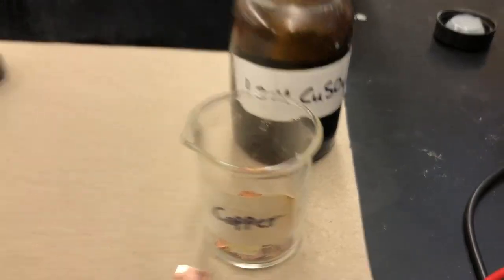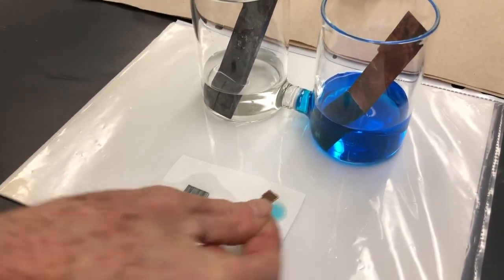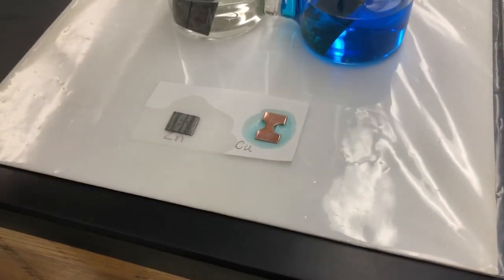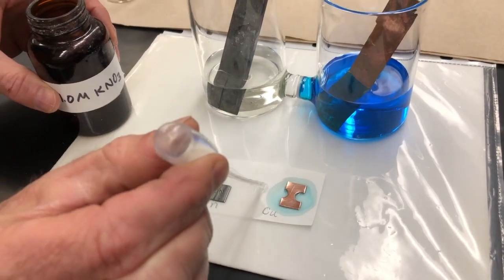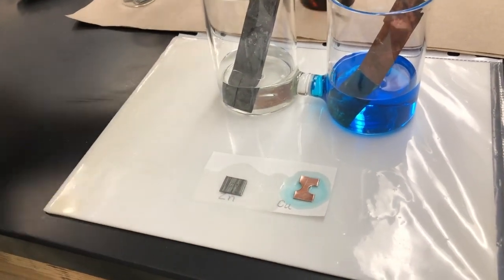Now on the other side, we have some copper 2+ solution and a piece of copper metal that has been previously cleaned — that is our copper 2+ solution and copper metal beaker. The salt bridge is going to be some potassium nitrate solution, so we'll put a little bit of that in between to make sure all the solutions are in contact with each other.